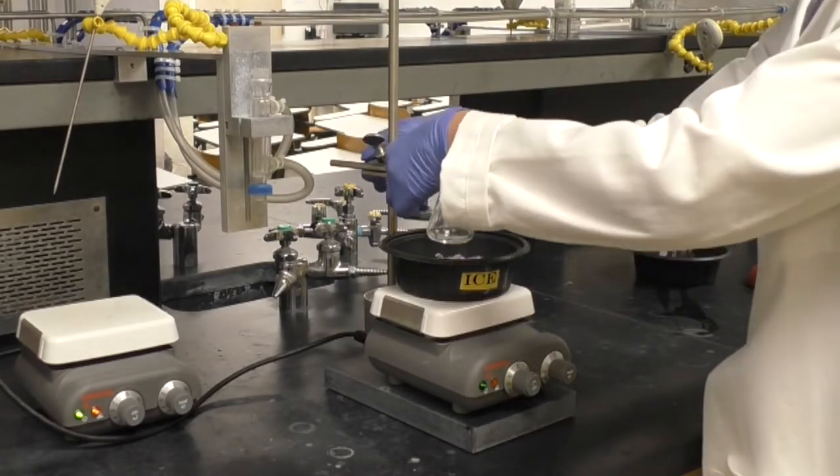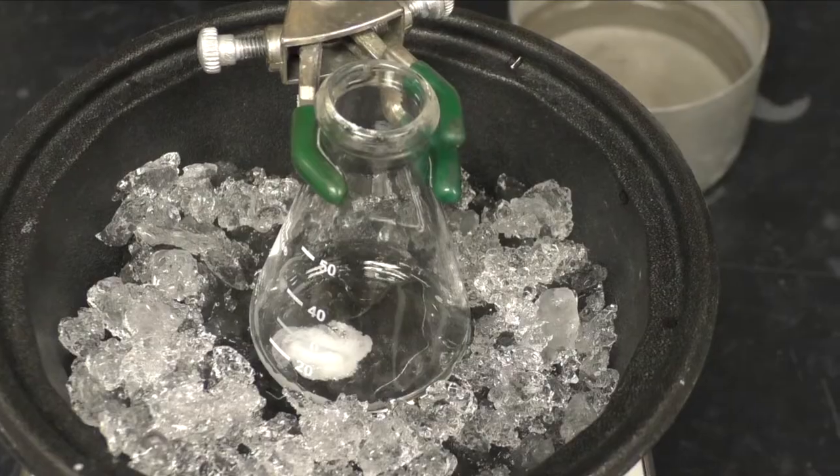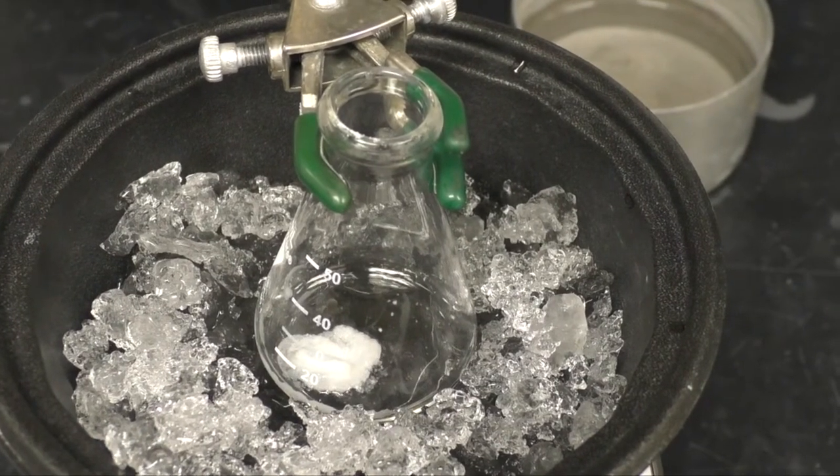Lower the flask into the ice bath with stirring. As shown here, crystals will form.